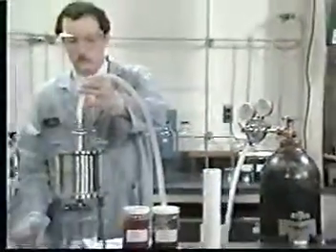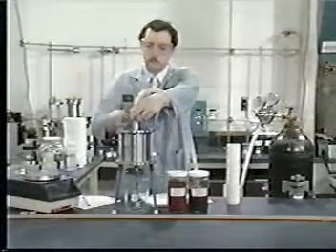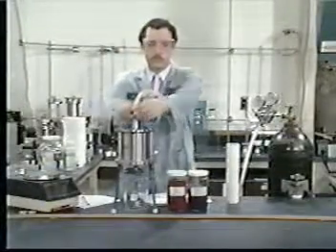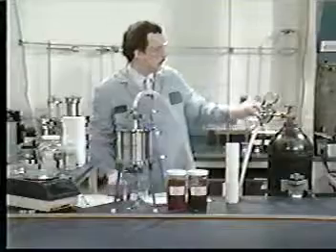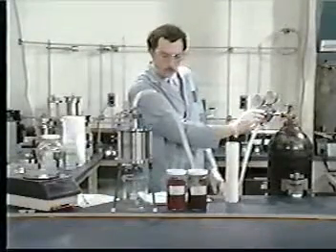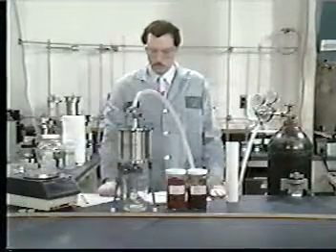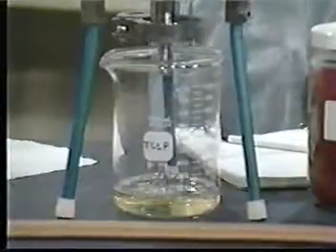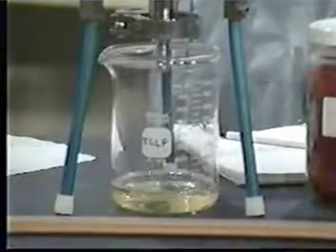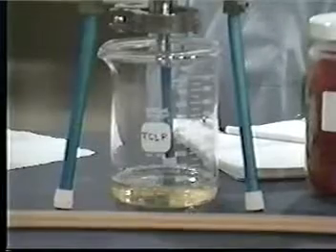Gradually apply 1 to 10 psi until the pressurizing gas moves through the filter. If in any 2-minute interval neither the gas nor liquid passes through the filter, increase the pressure in 10 psi increments to a maximum of 50 psi. Filtration is ended when the gas passes through the filter or when liquid flow has ceased at 50 psi.